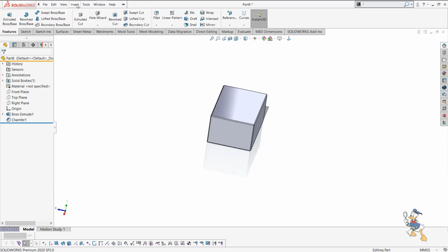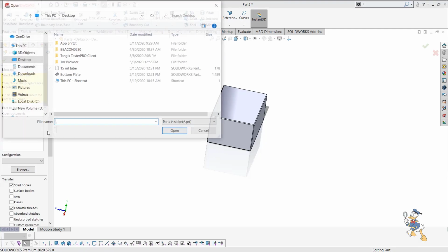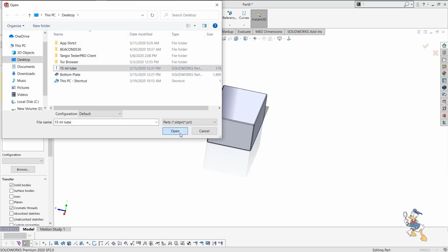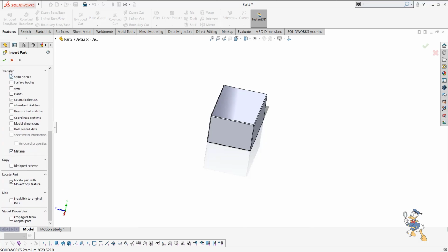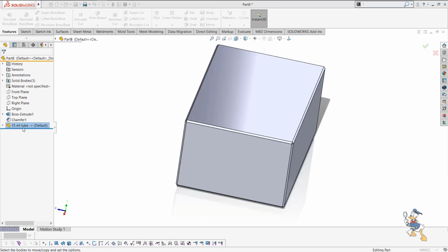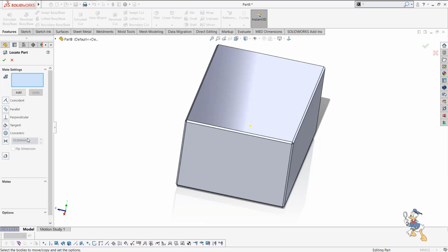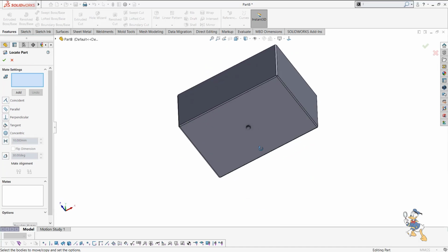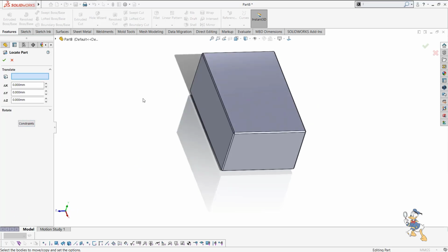And suppose I need to generate holes related to that plastic body which I have just designed. So I just need to insert that plastic component. It is also a multi-body designing facility available in SOLIDWORKS, where we can select any other part as well and insert it into our body. And by locating that body in the feature, we just need to provide some values. Suppose I need to move the upper side of the body, so we can move it, suppose I just need to generate it to Y.